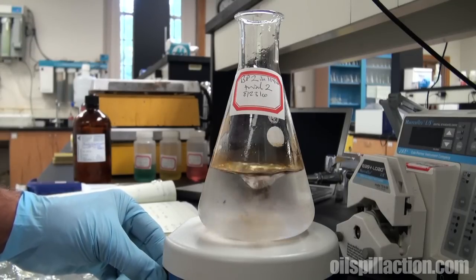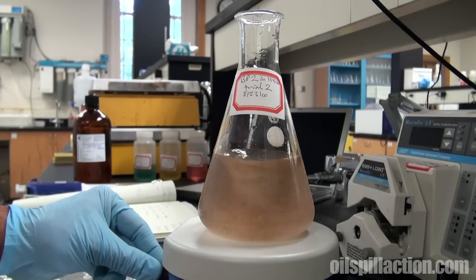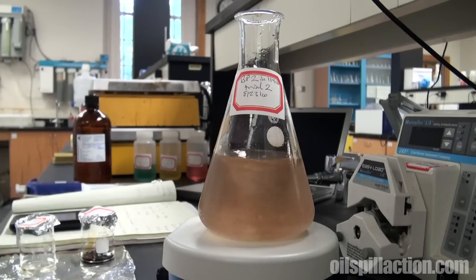It's been about a minute and a half since we first stopped that stirrer the first time. And we'll let that mix for a minute, just like we did before, and see if there are any differences.